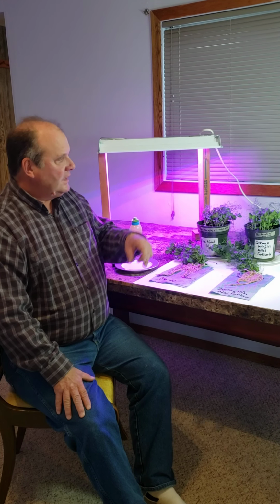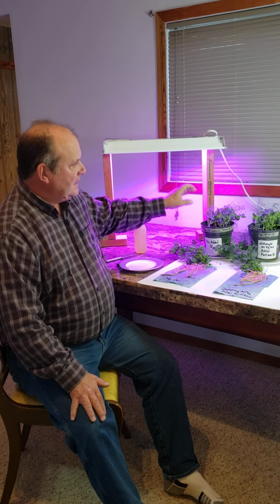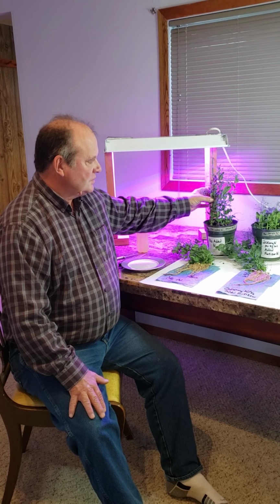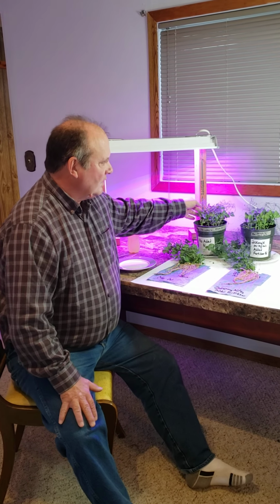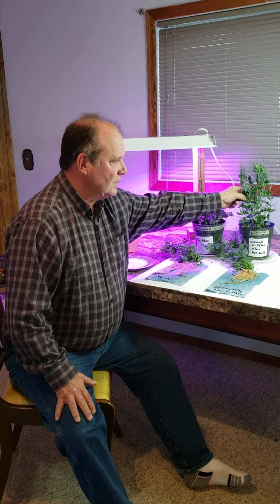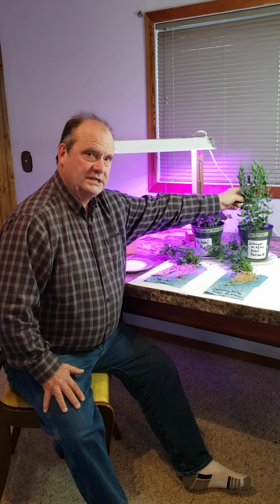The pea plants were seeded about 1 month ago, and we can see here, looking at the two different treatments that I had in terms of available nitrogen, the peas growing here on the soil with no added nitrogen, and a commercial inoculant added to the pea plant seeds, Rhizobium leguminosarum. And over here we have 200 milligrams of nitrogen per kilogram of soil that was added as fertilizer to this same soil. The pea seeds were inoculated with the same Rhizobium leguminosarum.